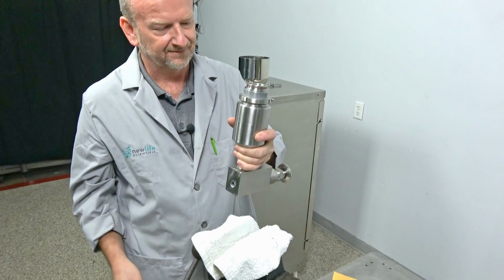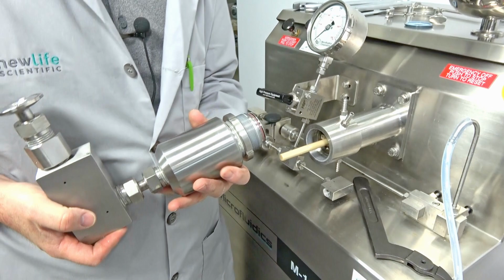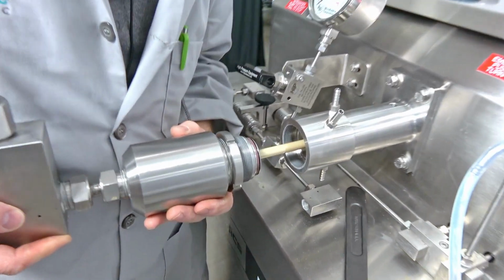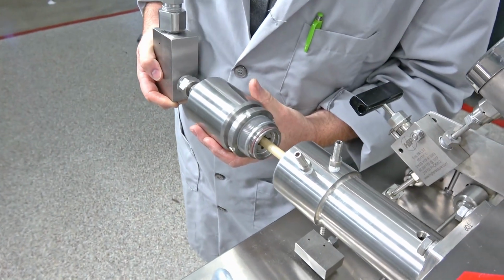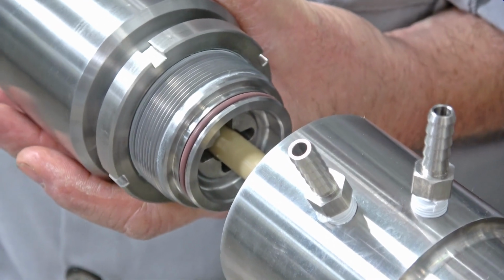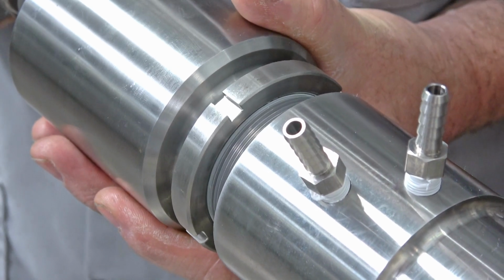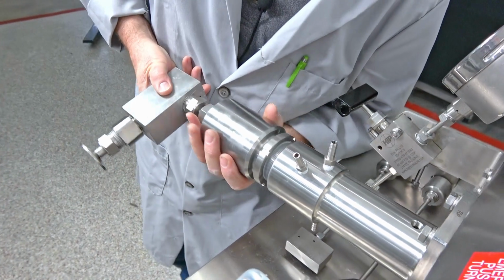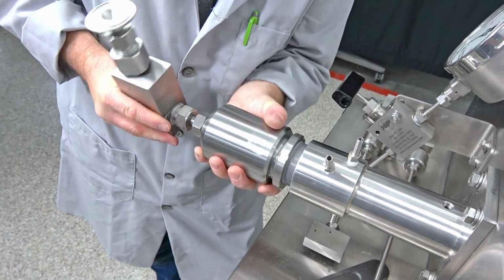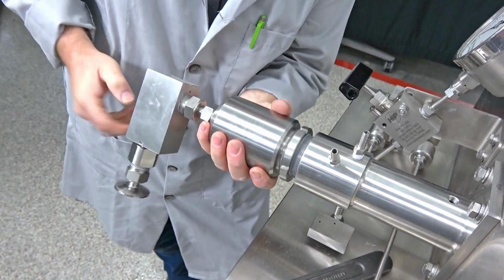So once you get that done, you're going to grab a hold of this and take it out of your vise. You're going to come back over here, and this is where you've got to be very, very careful. You have to line it up and just slowly wiggle it back and forth and guide it back onto the ceramic plunger. And then once you get the threads up there, just keep a little bit of back pressure. Get them threads started. Once you get them started, you're through the hard part.